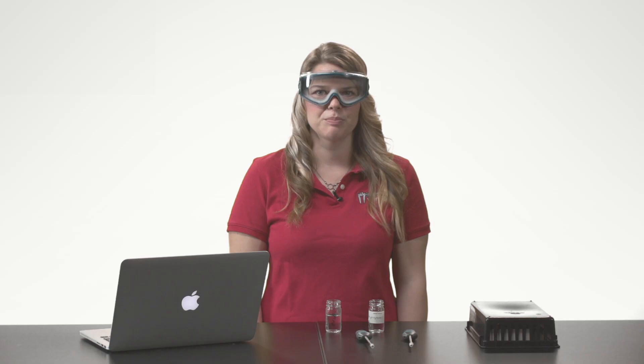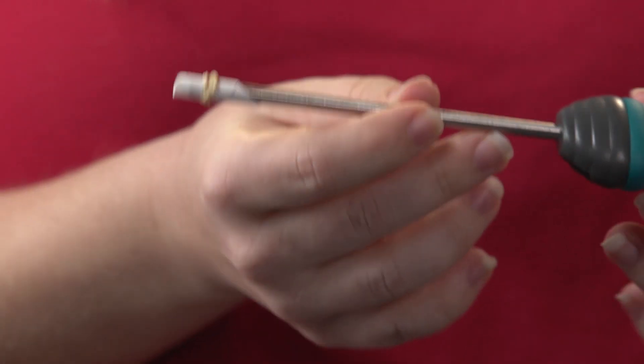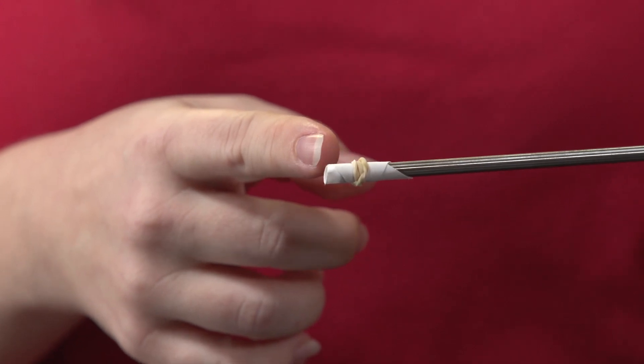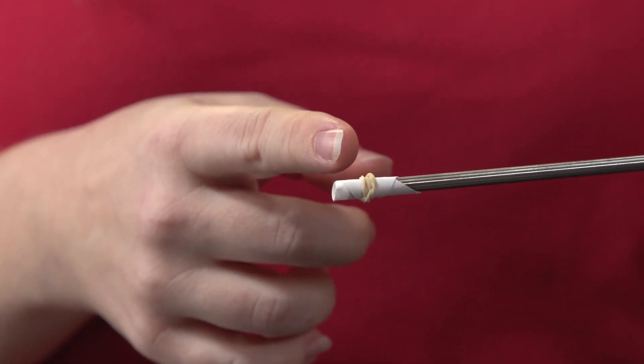Now that my software is set up, I want to prepare my temperature probes. I wrap a small piece of filter paper around the tip of the temperature probe and tighten it with a rubber band.